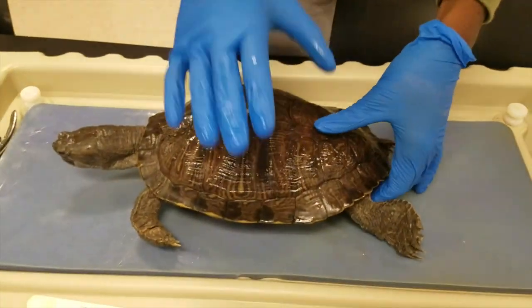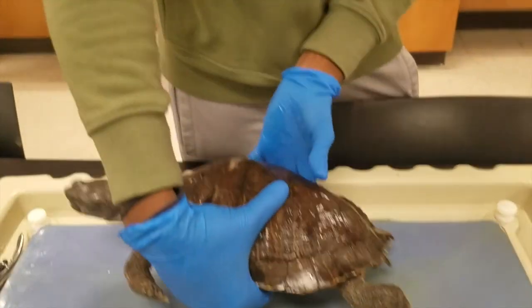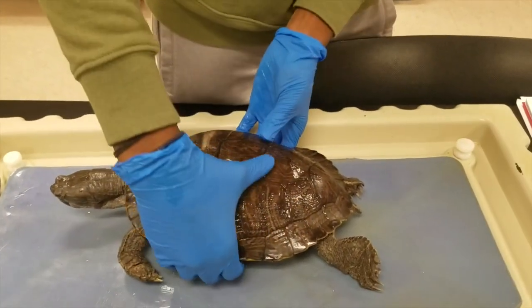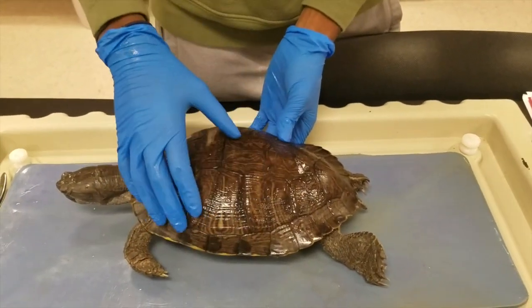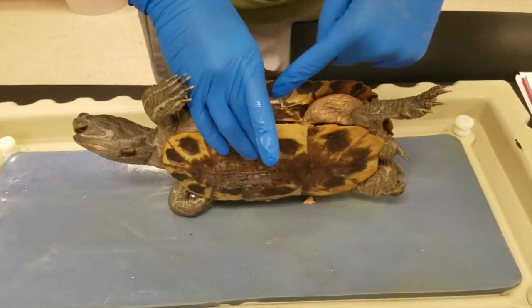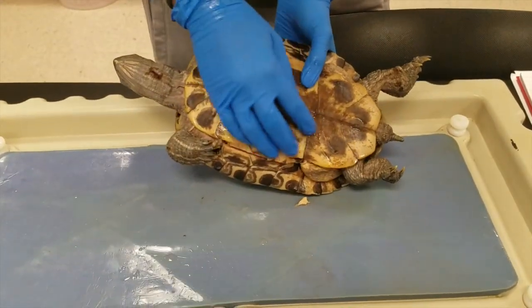Going to the dorsal and ventral sides of the turtle, we'll notice that it has a shell. The shell is broken up into three parts: we have the carapace, the bridge right here, and the plastron.